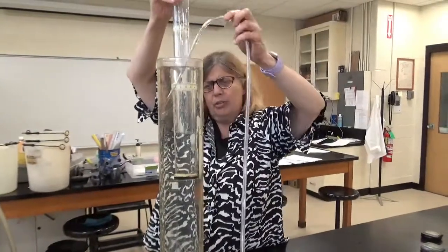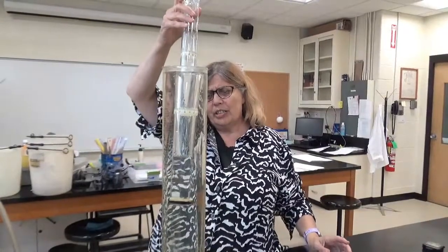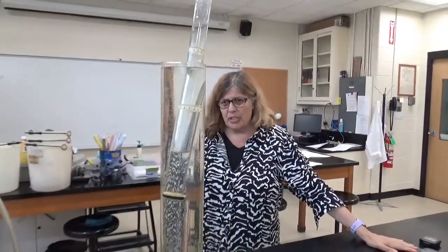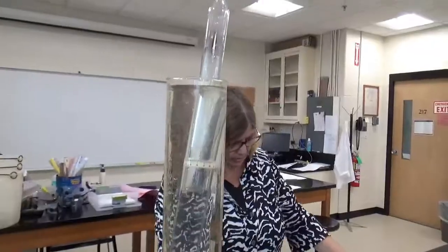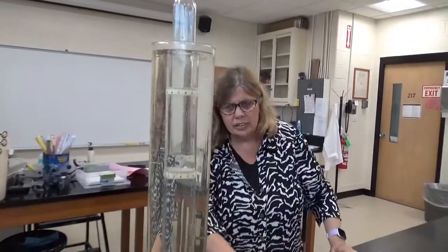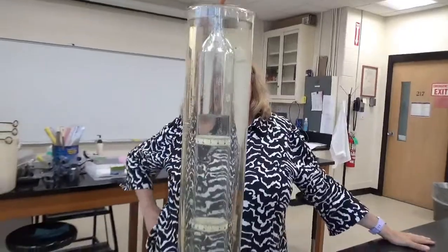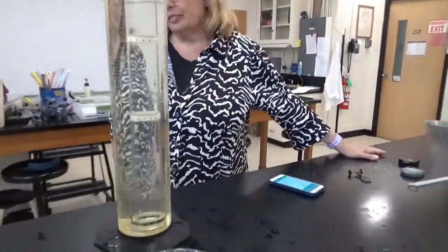Okay, I'm going to get rid of the tube now. And what I'm going to do is let it go, and I'm going to say start when it passes the bottom of the first tape. First, I have to take this off. Ready? Start. Stop. Okay, I got 8.05. I got 7.73. Oh, good.